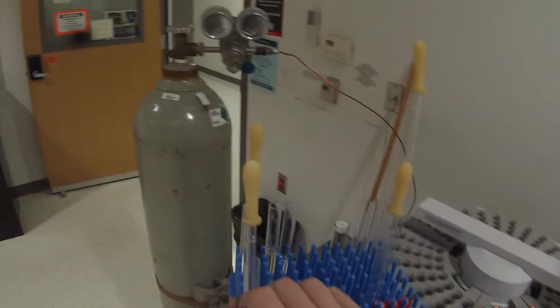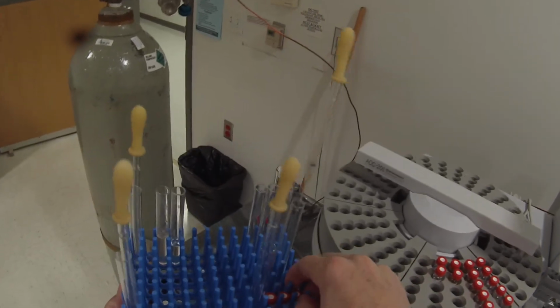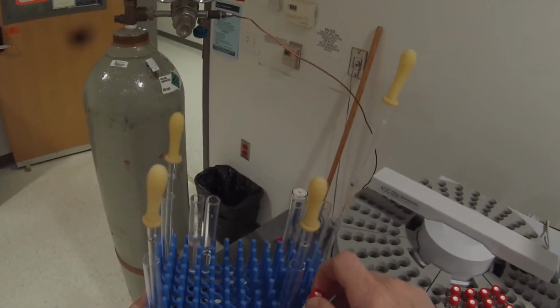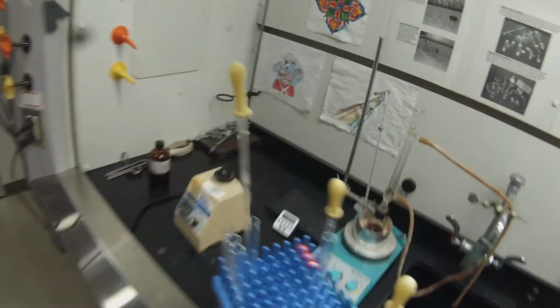54K was the 60 minute, and 54L was the 75 minute, and then the 90 minute that I just took, right, that's going to be 54M, and then we'll have 54N and 54O in slots 14 and 15 respectively. So I'm going to put this back. And then we will build our batch file.